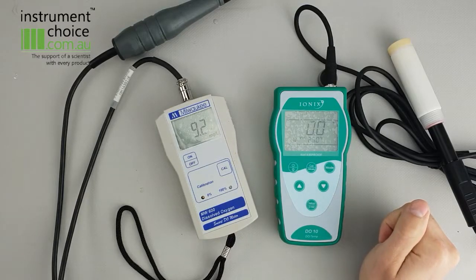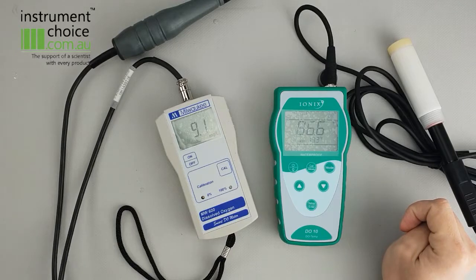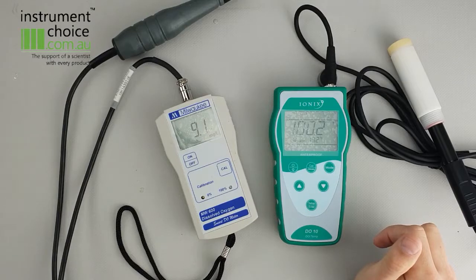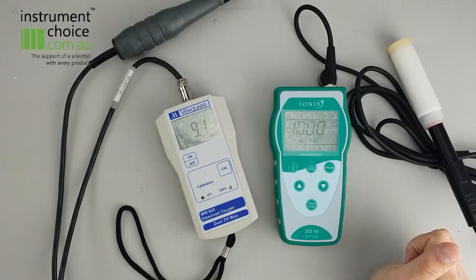So to do that, you just power on the meter and ensure that the calibration sleeve has been on there for about five minutes with a slight amount of moisture in there before you do it. Leave it for a couple of seconds just to stabilise. Once it's stabilised, hit the CAL button — it'll flash up with calibration. Hit the enter button, it'll calibrate it to 100%, and you're ready to go.